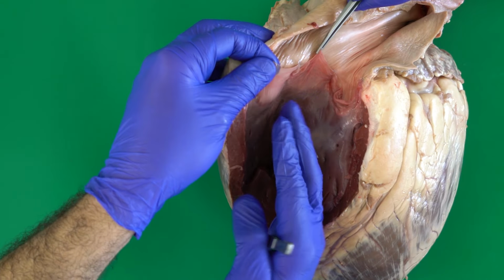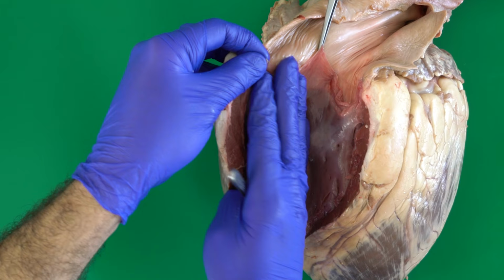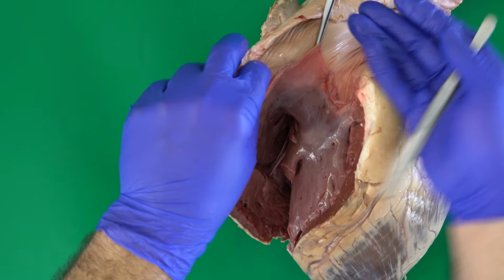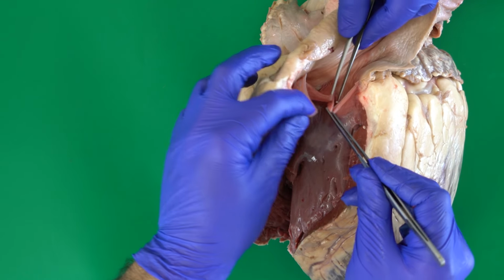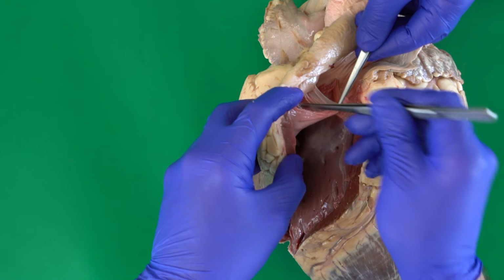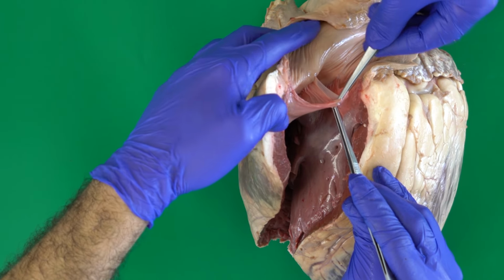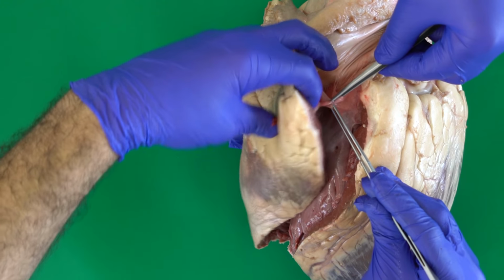So in this case, if the blood moves from the right ventricle toward the pulmonary trunk, these valvula, semilunar valvula, will just be pushed to the wall of the pulmonary trunk, just like this, allowing the blood to go to the pulmonary trunk and from there to the lung. The blood cannot come back, because once the blood comes back, it will fill these pockets completely, in the way that they will close the opening between the pulmonary trunk and the right ventricle, and in this case, the blood cannot go.